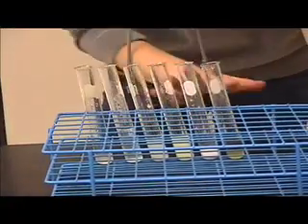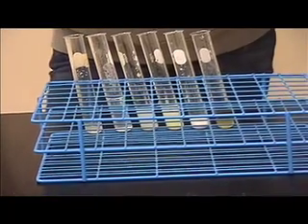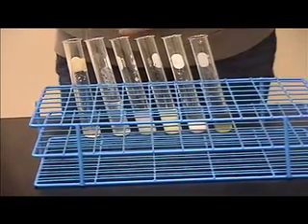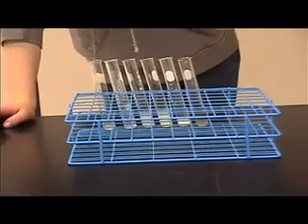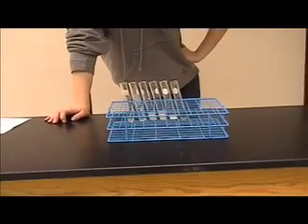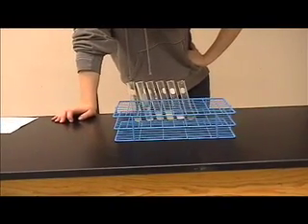Okay. So, here are all six anions that we tested for today. So, if you ever want to know what an anion is, you don't know what it is, just perform one of these tests that we've shown you and you can figure out what it is. So, thank you so much for watching with us today.